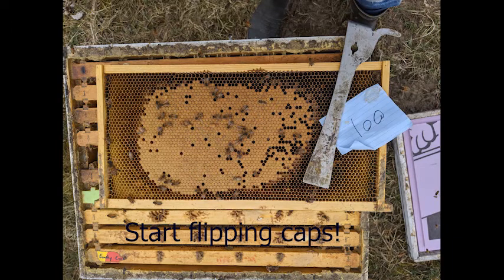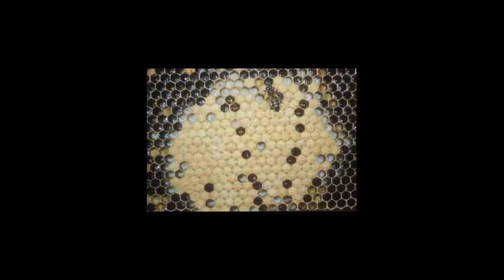And to do this, we go out into the field and we collect a frame where there's lots of bee larvae that are not quite capped, but will be capped within about 24 hours. We then brush up all the bees and bring them into the lab. Now, these bees, again, they're not capped.